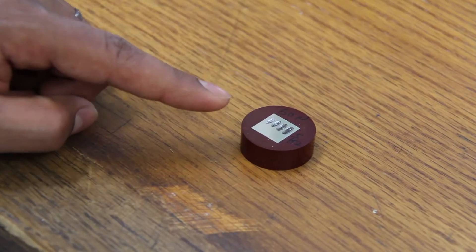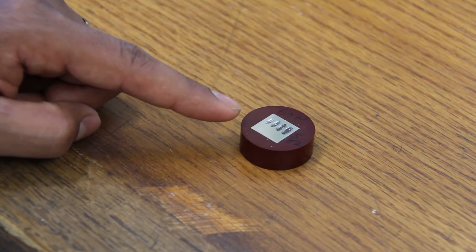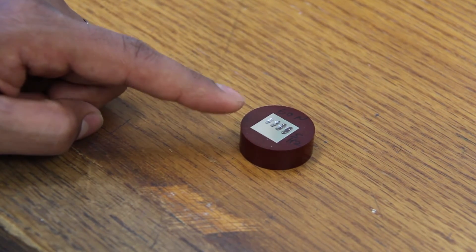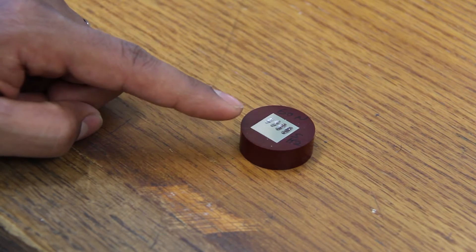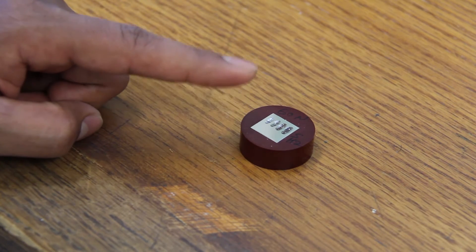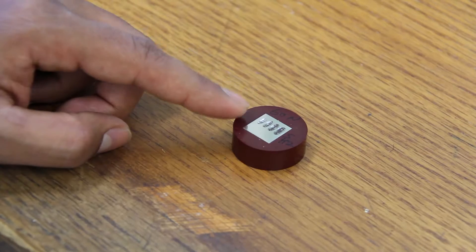Here is our sample. We have performed reciprocating wear test on this sample. We would like to do the optical profile of these specimens.